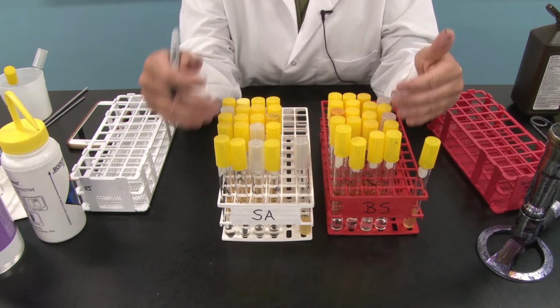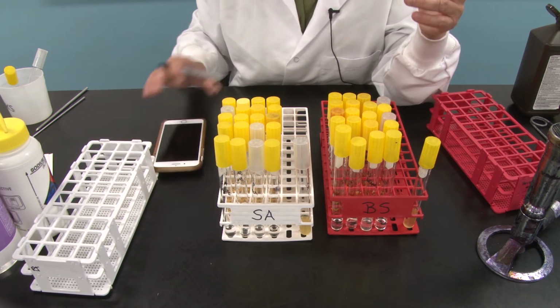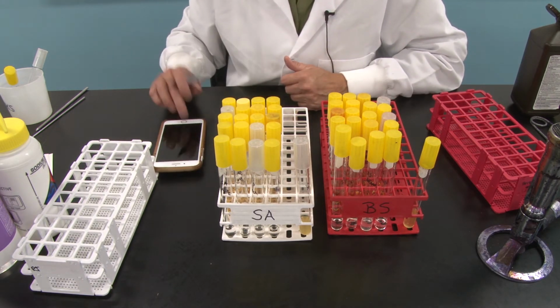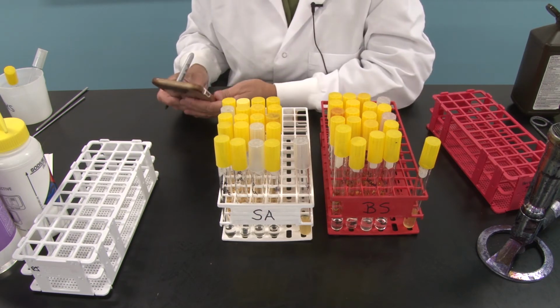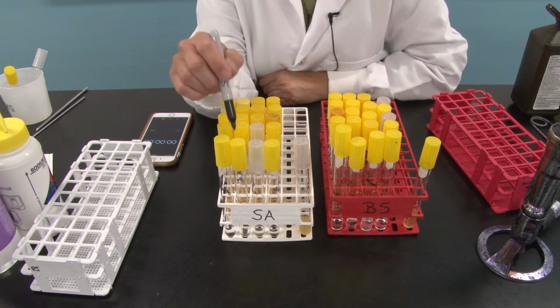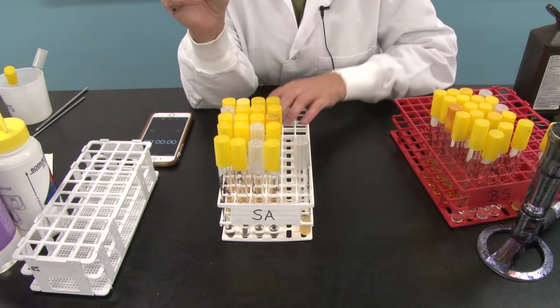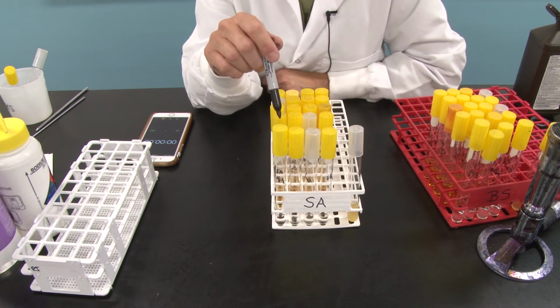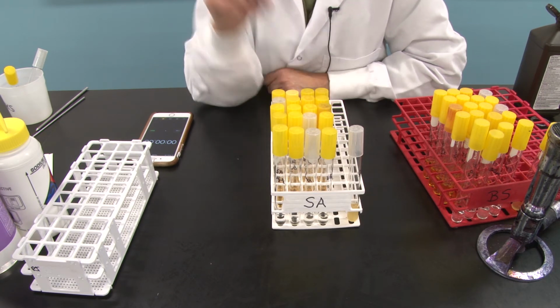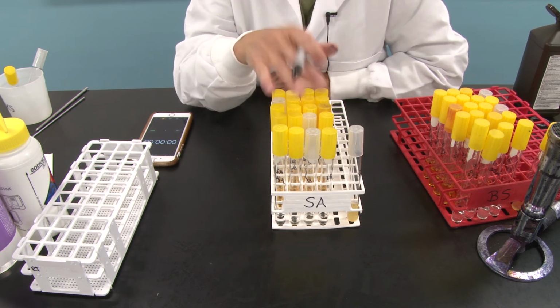But I'm not going to do this till I am ready to rock and roll because I have to time this procedure. So I actually do have my cell phone here. I will disinfect it after I am done just to be safe. But this is actually my stopwatch, okay? Now, after I inoculate these, I'm going to inoculate these in sequence. I'm going to do the Staph aureus set first. I'm going to inoculate 2 loopfuls here, 2 loopfuls here, 2 loopfuls here, 2 loopfuls here. I'm going to start my timer after I've inoculated all 4 sets.